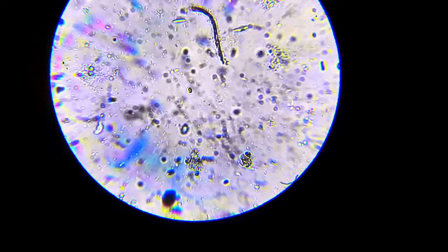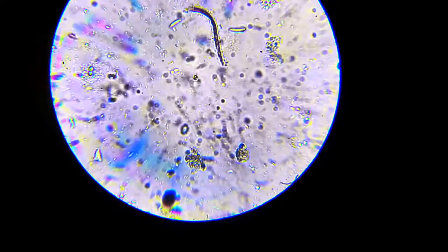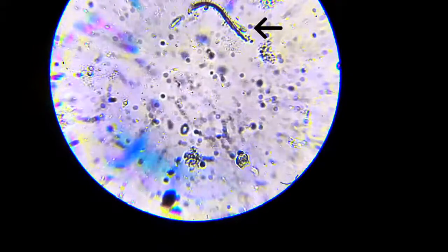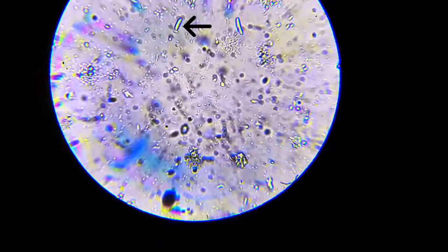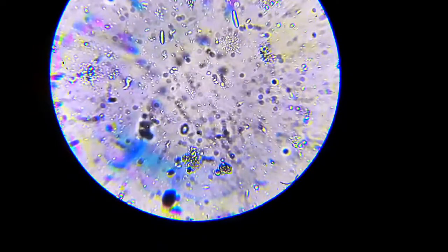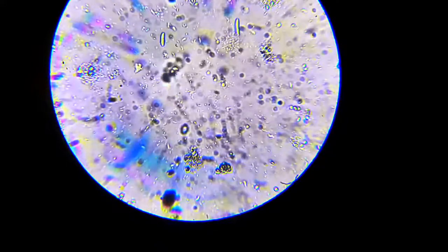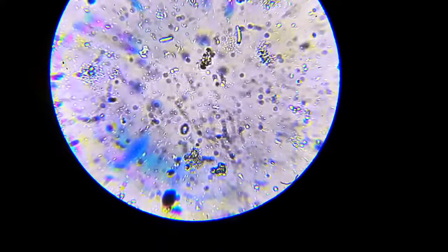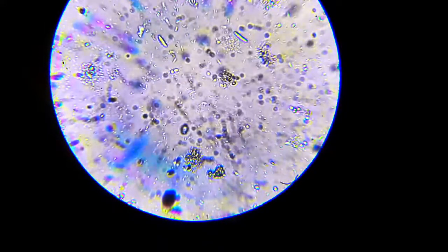Here is a time-lapse of that video. You can actually see two of the large bacteria moving on the top, and there is also some amoeba, which is a type of protozoa.